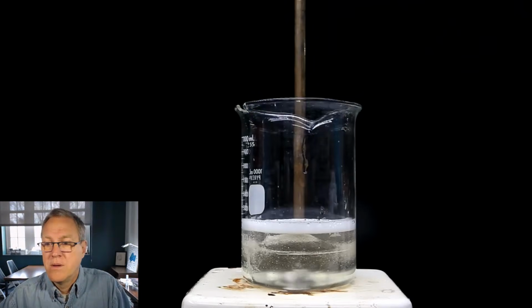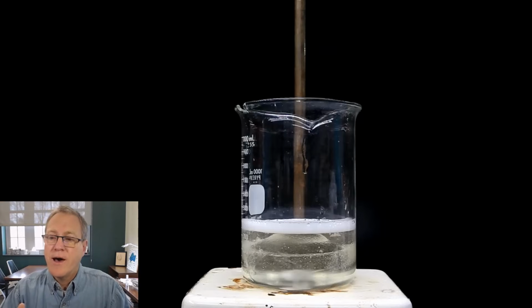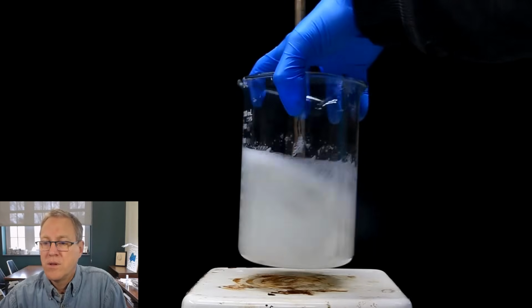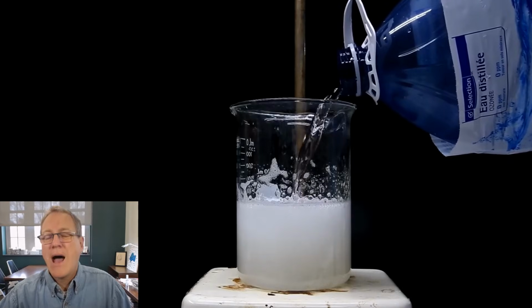You can see the more watery top layer is just floating on top of the thicker lower layer, and when I turn on the stirring, the bottom layer kind of just bubbles up. It is thick. Let me fix my lights. There we go. Okay, it is very thick, and so that stir bar has a hard time getting things mixed up. This will mix in. It just takes a little bit of time. Even if the beaker is lifted up and shaken manually, it doesn't really mix all that well. To get it to all be one homogeneous mixture, we need to add more water.